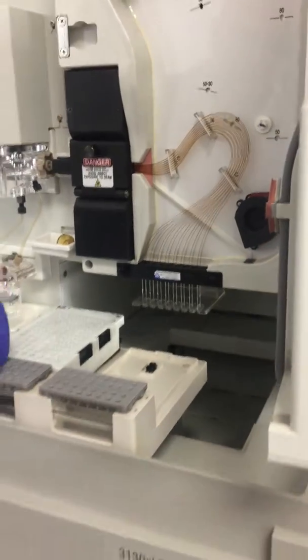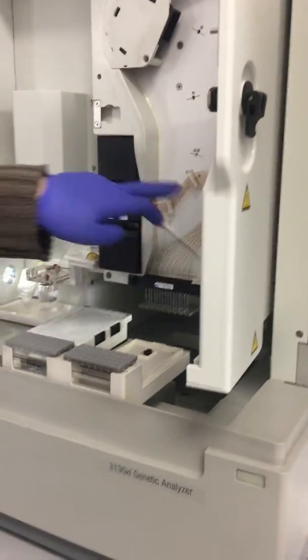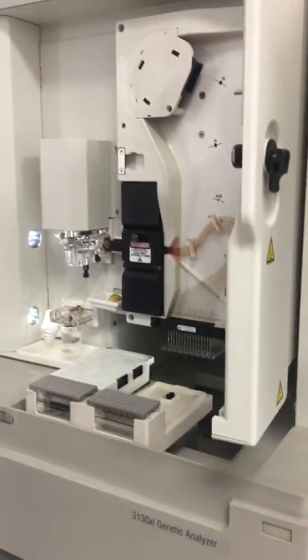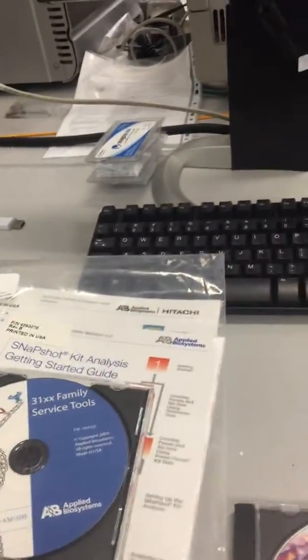Okay. So I think we'll just empty all those buffers and waters and things. Yeah. But I don't know whether it's best to move it with that in place or not, but I think we may as well just leave it in place. Yeah, leave it in place. Just scan round here. So that's the data collection software, genetic analyzer. It's got the GeneMapper software.